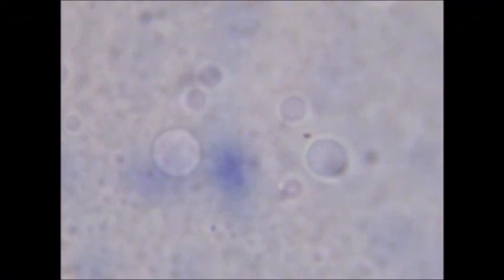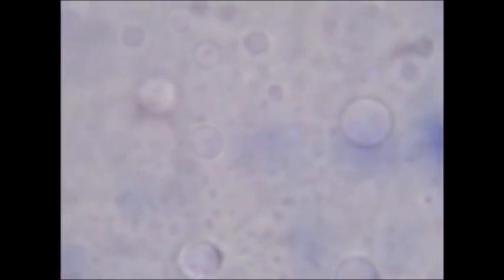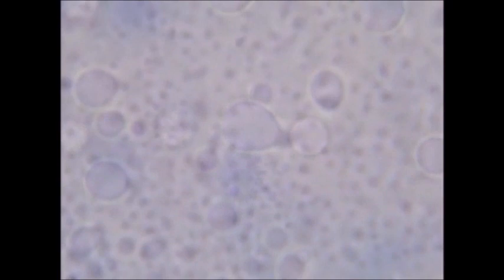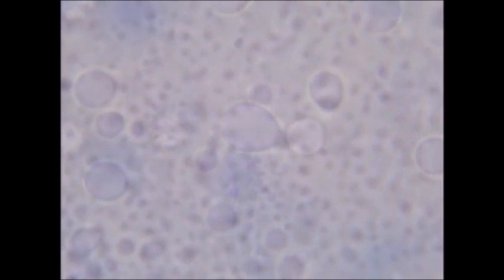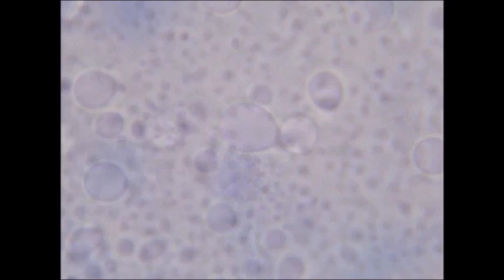Hello everyone. In a previous video I had promised that I wouldn't make any more videos concerning fatty acid vesicles. However, these are not vesicles made from fatty acids — these are lecithin vesicles. I took some liquid lecithin and added it to water, stained it with methylene blue, and this is what resulted under the microscope. These are magnified a thousand times.